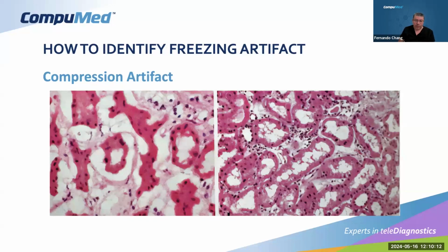is different. It's just that the tissue on the left is what we were cutting as the frozen section, and the tissue on the right is the same tissue exposed to the lower temperature, but with the overnight process. So we can see these crushing areas on the tubules. And if we compare this, you can see the epithelium of this tubuli perfectly preserved, to the extent of using a tissue that was previously exposed to freezing, but still you can see the contours and the architecture preserved.